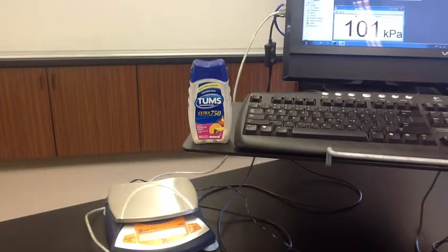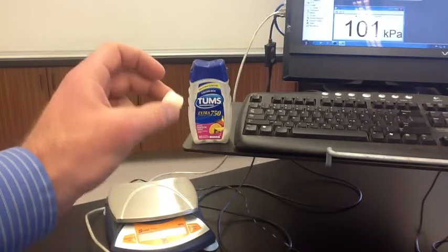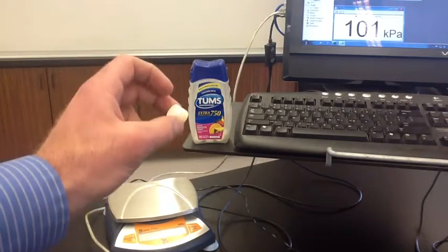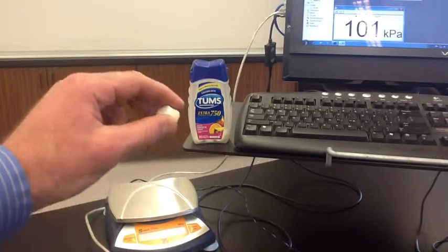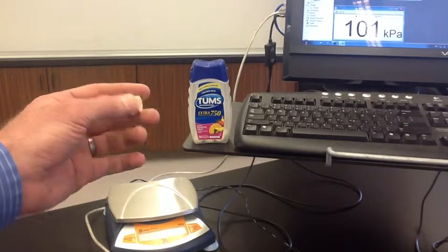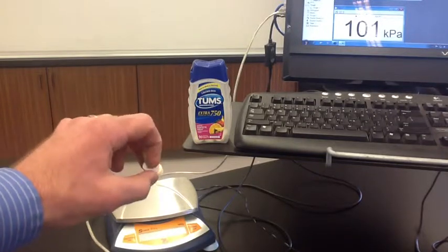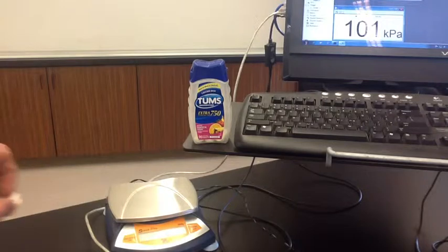In the Tums tablets, it's not just calcium carbonate. There's also sugar and flavoring and other chemicals. What we want to do is figure out what percent of these tablets are calcium carbonate and what percent is something else.